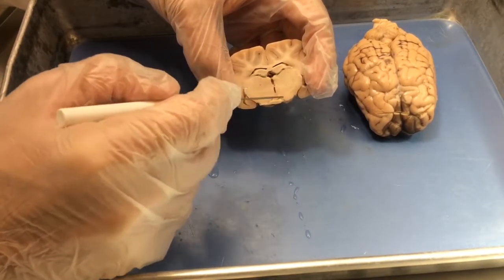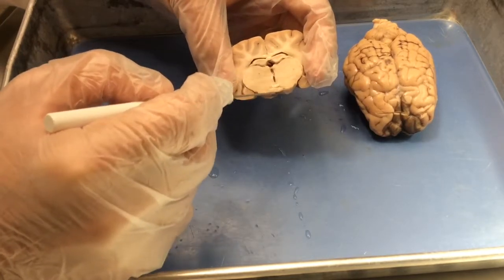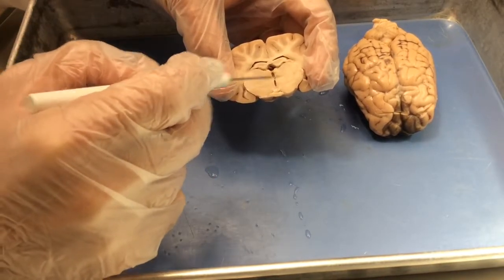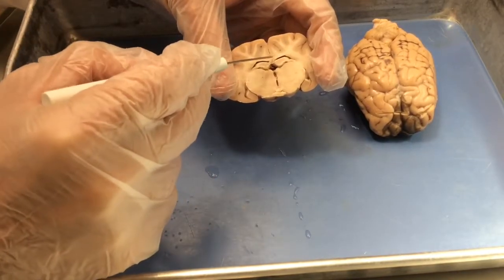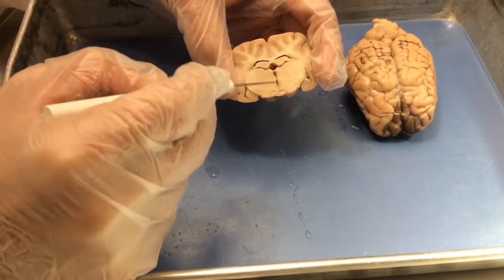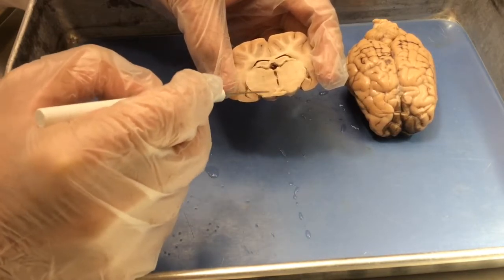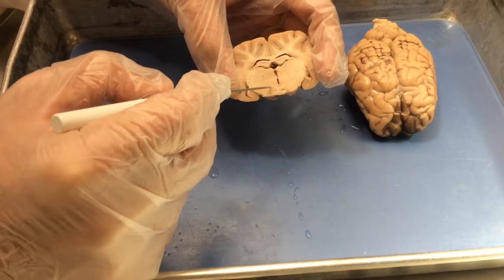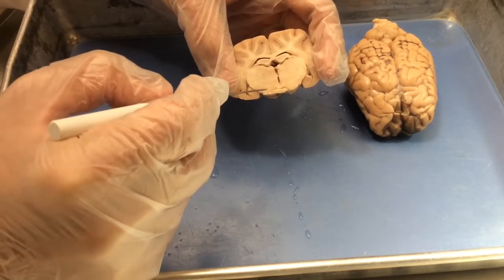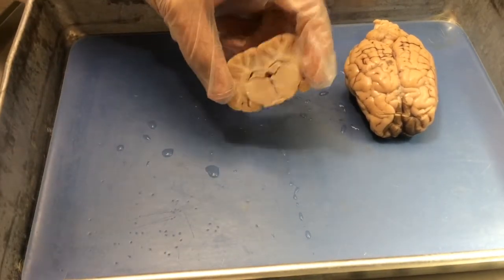Lateral to the third ventricle is the thalamus and hypothalamus. And sometimes you'll see the optic chiasm below it, depending on how far back you are. So we have cortex, corpus callosum, lateral ventricle, hippocampus, third ventricle, thalamus, and hypothalamus. The dividing line between the thalamus and the hypothalamus is difficult to see. Sometimes you can see some white matter that seems to define a border between the thalamus and the hypothalamus, but they're just right up next to one another.